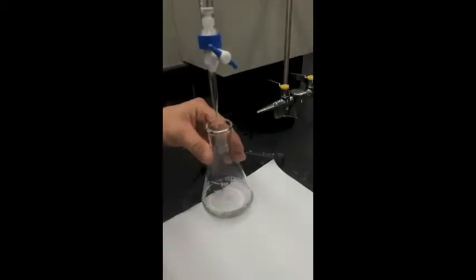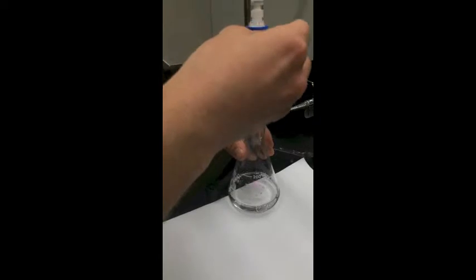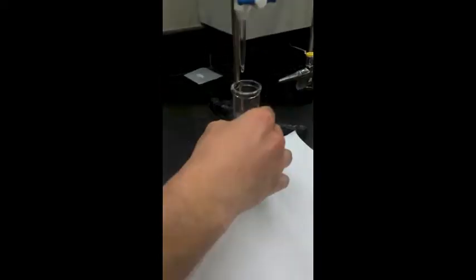Do it on that side so you can see it, like stir it on the side. See some pink color? No, like I can't see. Use your left hand. I'm right-handed. Okay, I'll go right.